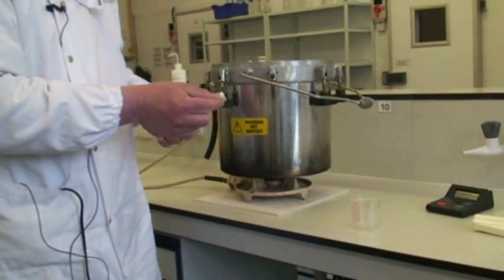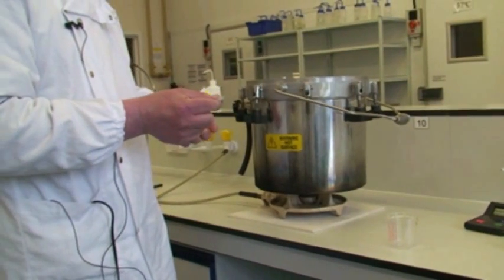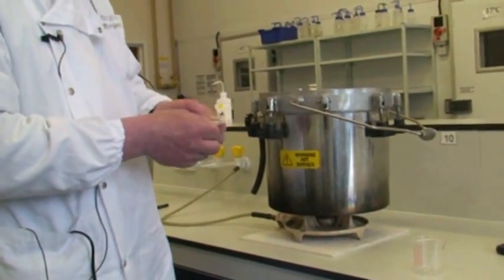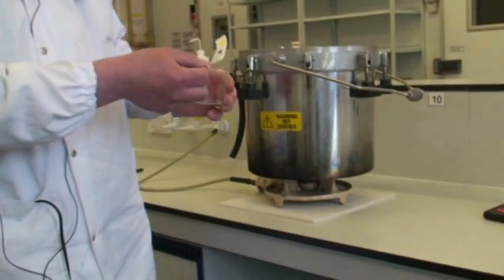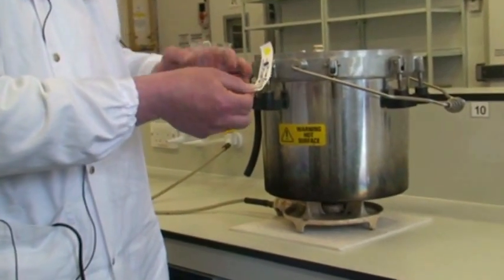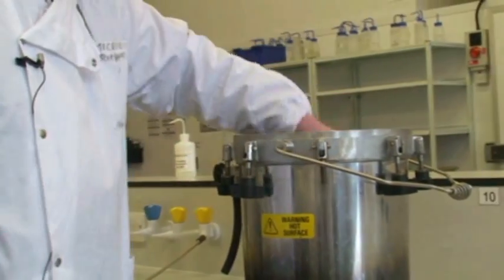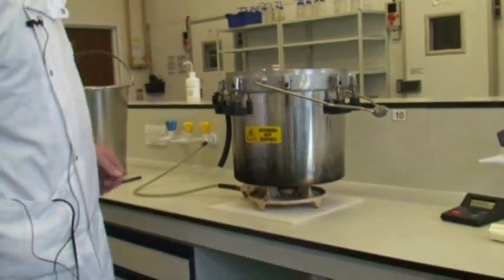Right, so for each process you need to ensure sterilization. It's not necessarily every single run, but occasionally you need to use a sterility test indicator like this. Just pop it inside a beaker and pop it in with the items you want to sterilize.